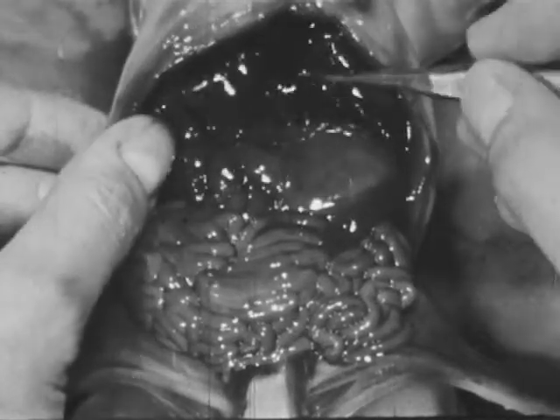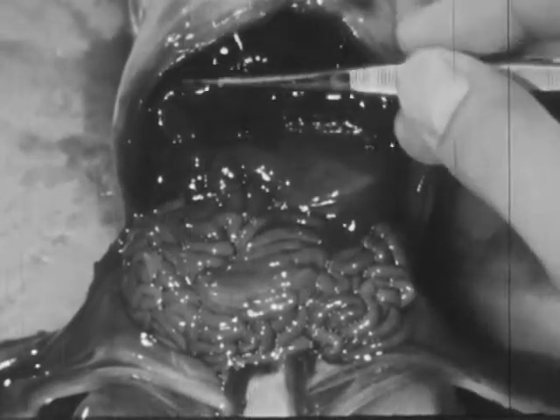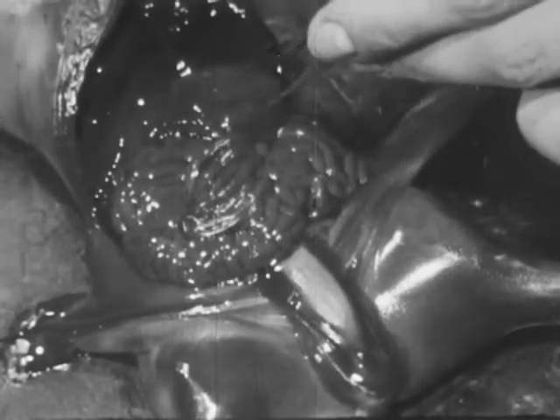The liver secretes bile, which is stored and concentrated in the gallbladder. When needed, the bile flows from the gallbladder through a duct to the duodenum. The pancreas lies under the stomach and secretes several digestive enzymes, which pass into the duodenum.